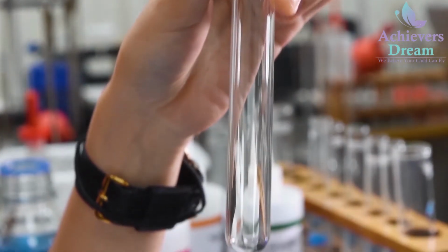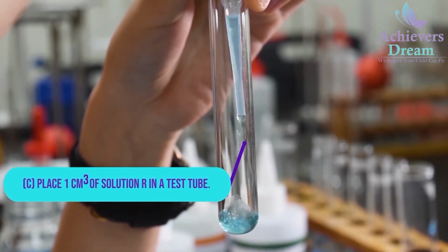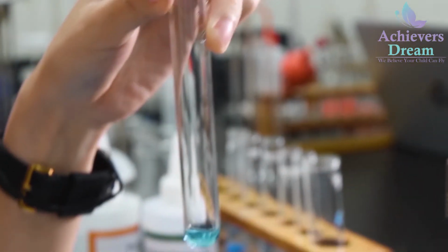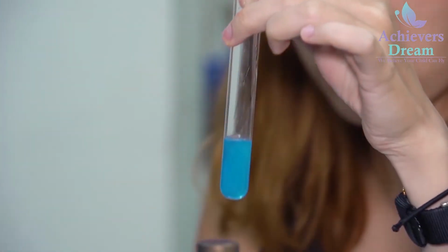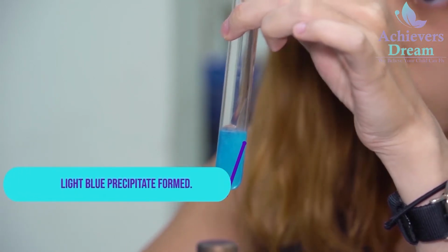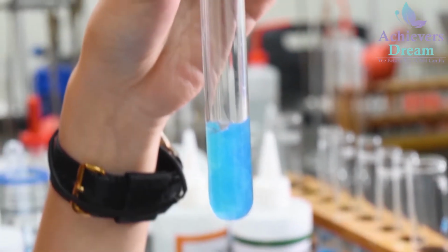The next step is to place 1 cm cube of solution R in a test tube, followed by 2 cm cube of NaOH. Your observation is that upon addition of NaOH, there is presence of a light blue precipitate. Then I'm going to add in a piece of aluminium foil and warm this mixture.